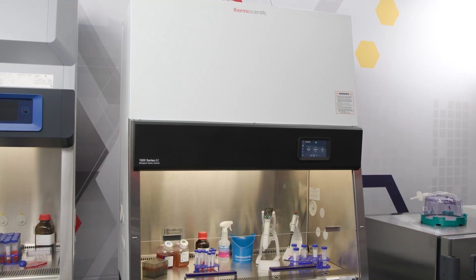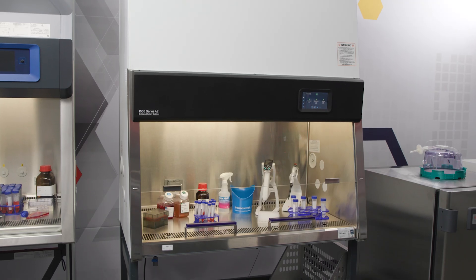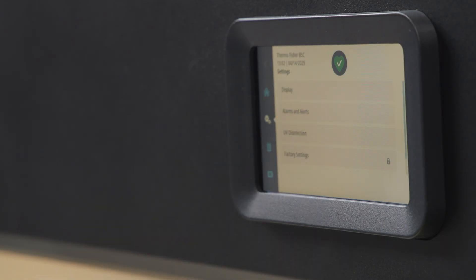In this video, we'll show you how to operate the Thermo Scientific 1500 Series A2 biosafety cabinet user interface.